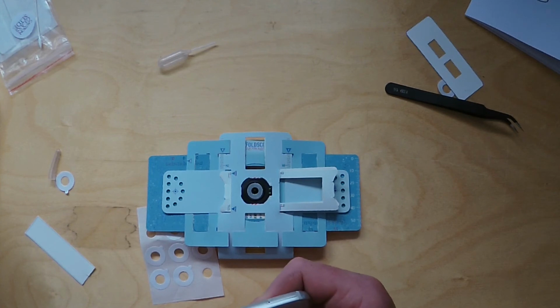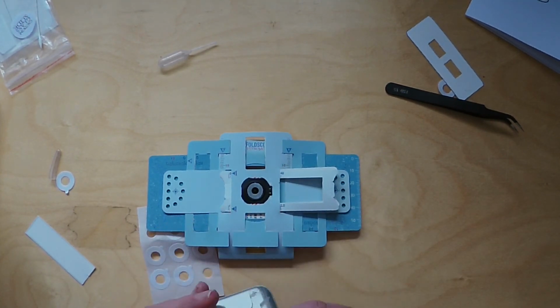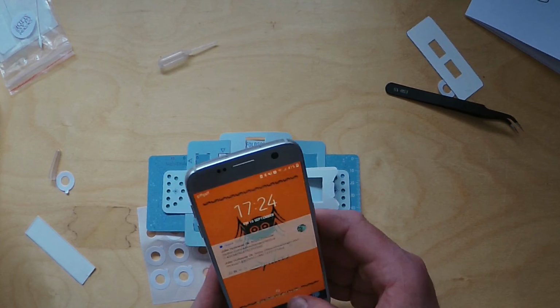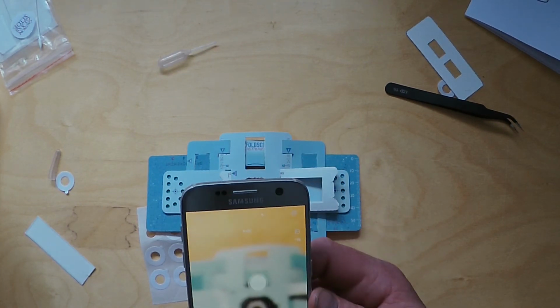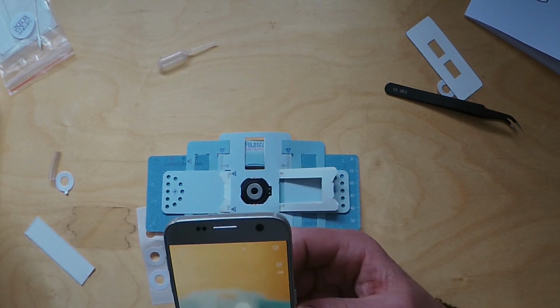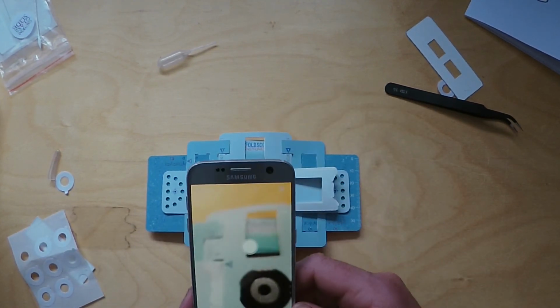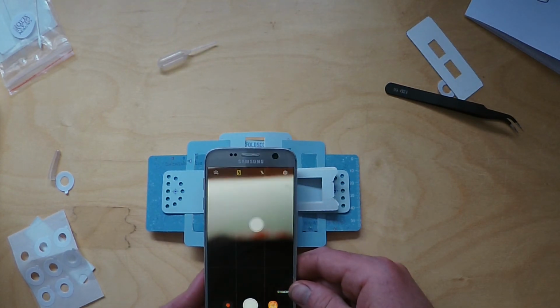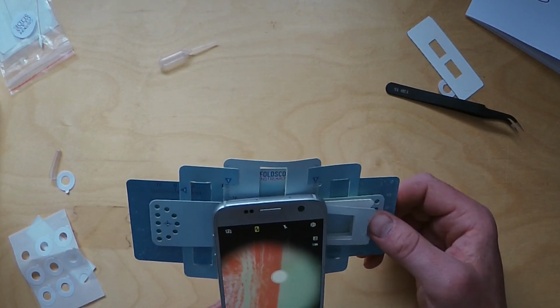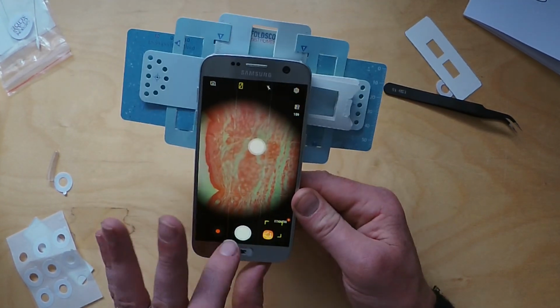So now that's nicely stuck, and the stickiness does wear off. You do have to replace the sticker after a while, but it works for a while. So we'll just open up my phone and you'll see immediately, because the lens coupler's stuck around the lens, it's not in focus because the lens is picking up the fact there's a frame around it. But when you bring it close to the lens here, you get into focus, and then the magnetics snap it in place, and there you go. That's our sample. Oops, I've lost it. There it is. And that's basically how you capture some images.